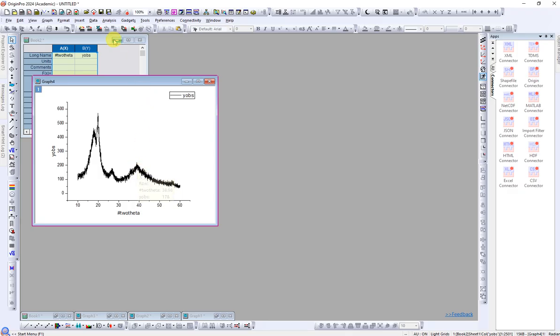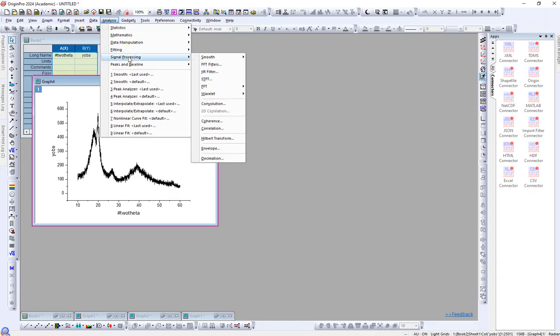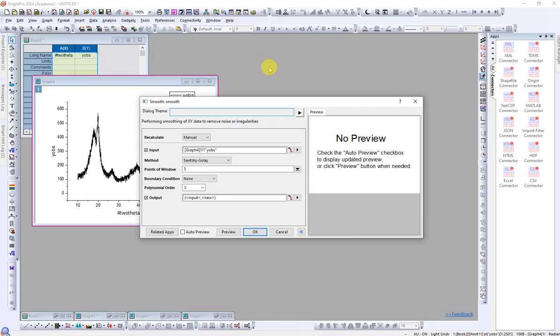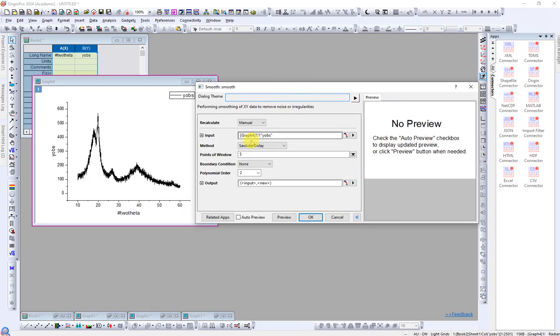So click on Analysis, click on Signal Processing, click on Smooth, then Open Dialog. Okay, once the dialog box is open, you have to make sure you have chosen the right graph, graph 4. This is graph 4. And then there are some methods which can be used to smooth the graph. I will choose the default method.